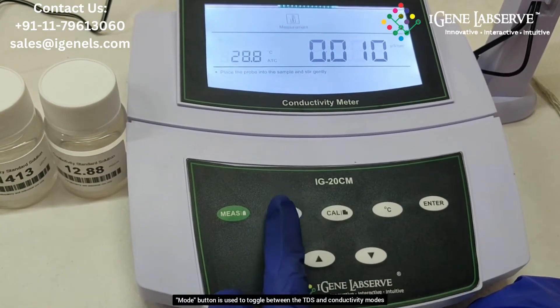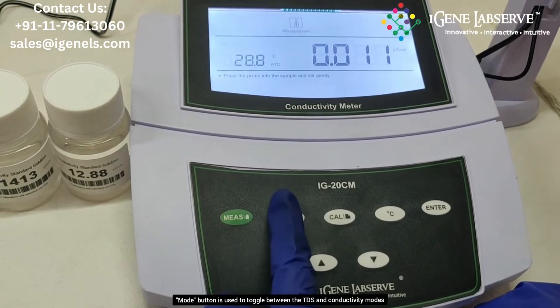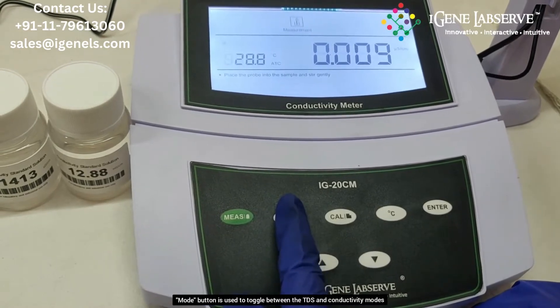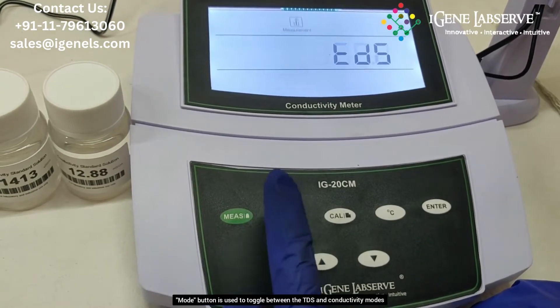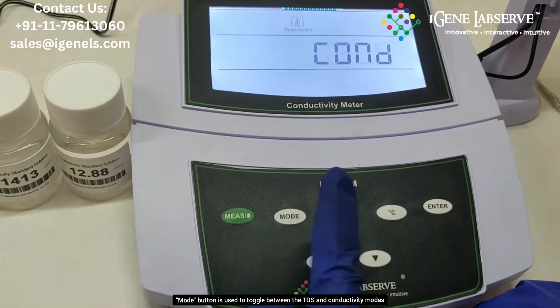This particular button is used to change the mode, so you can switch between TDS and conductivity.